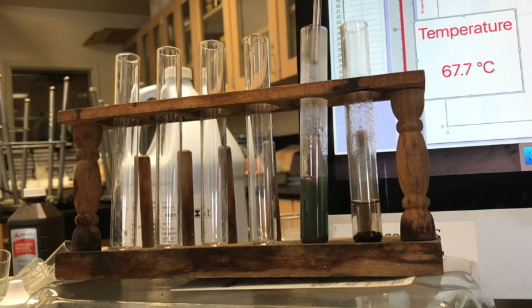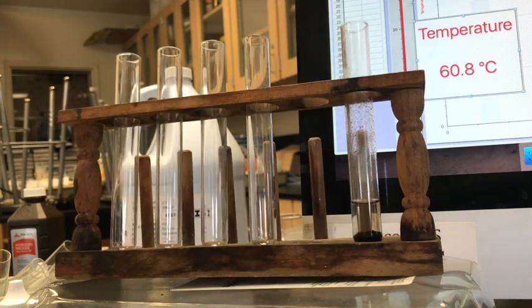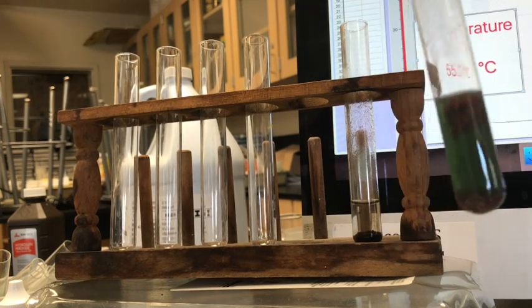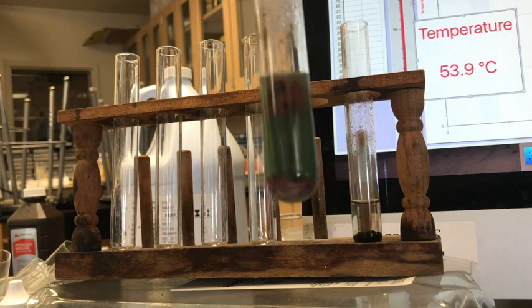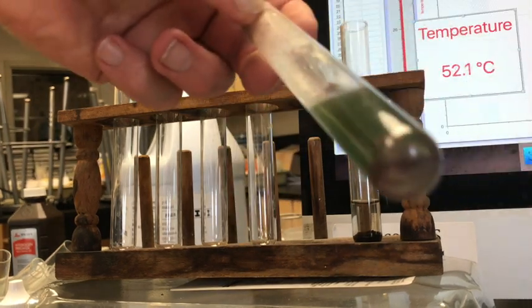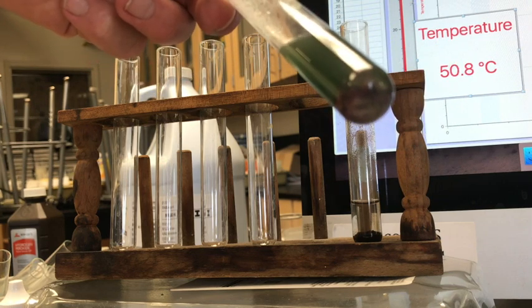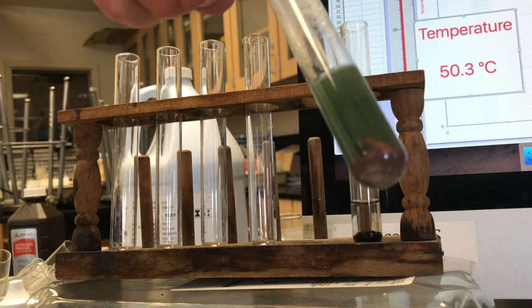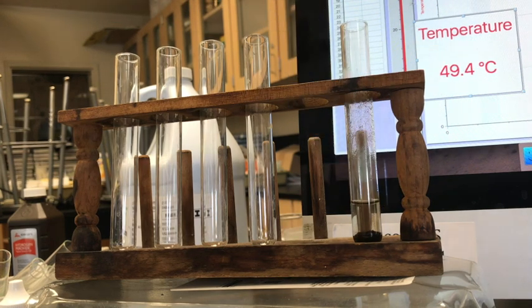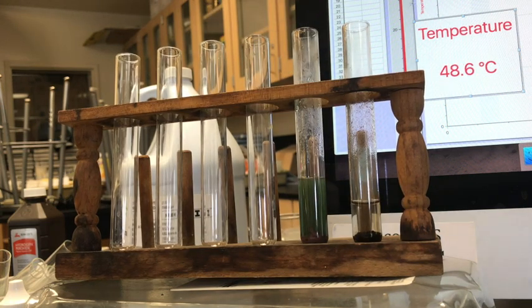We'll come back and look at some more of that, but since you're writing stuff down, looks like the original blue color is gone, or quite a bit of it's gone. And there at the bottom is like a brownish red color that's happening. So we'll come back and we'll look at each of these.